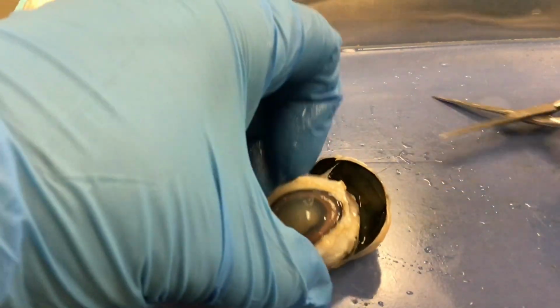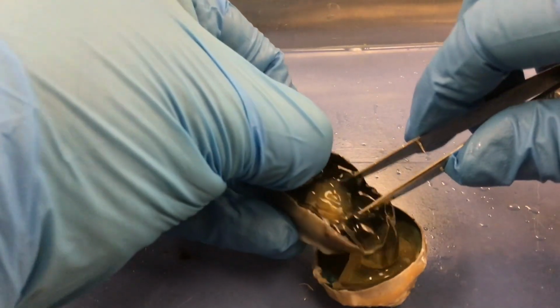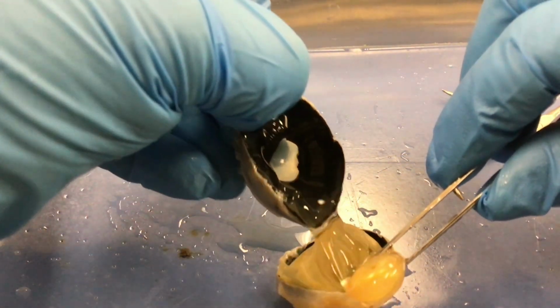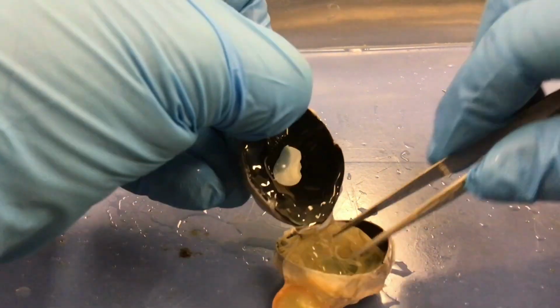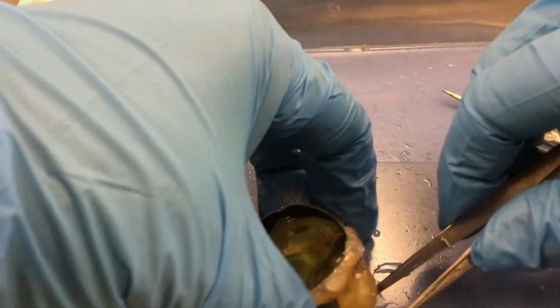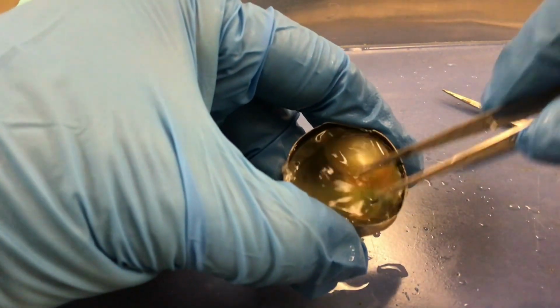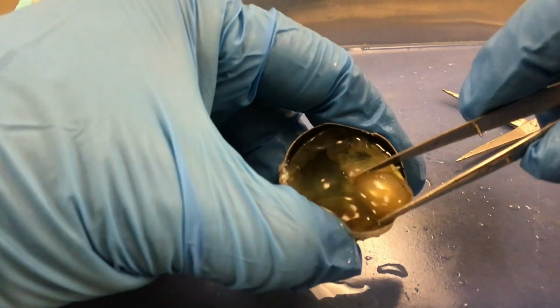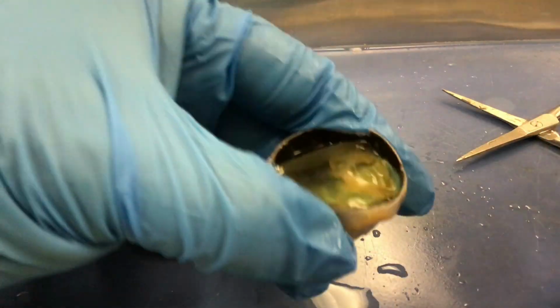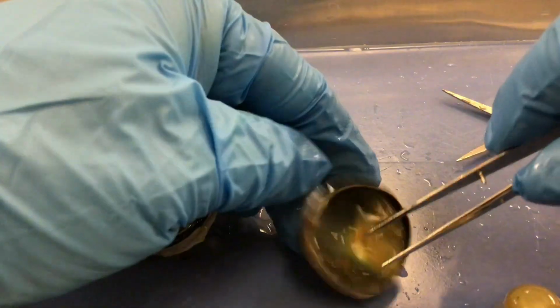Okay, so then we have the anterior part. This jelly-like stuff, the vitreous humor, is attached to this hard little ball called the lens. So it sits in like this. There's the lens, and then the jelly is the vitreous humor. So I'm going to pull that out very carefully. I'm going to try to leave the retina as much as possible in there. You see it wanting to come out a little bit.